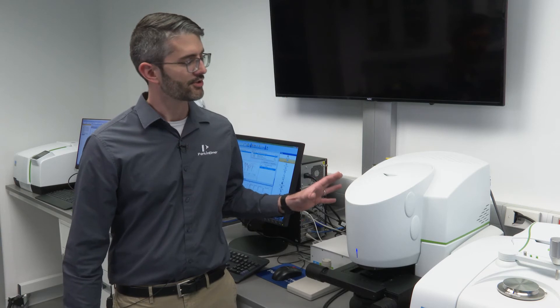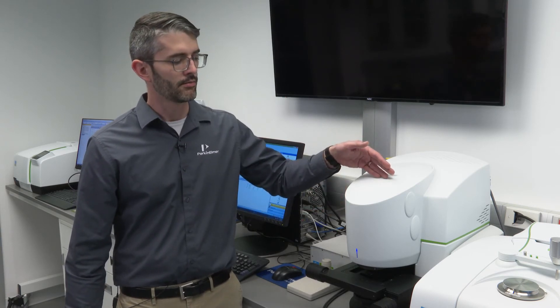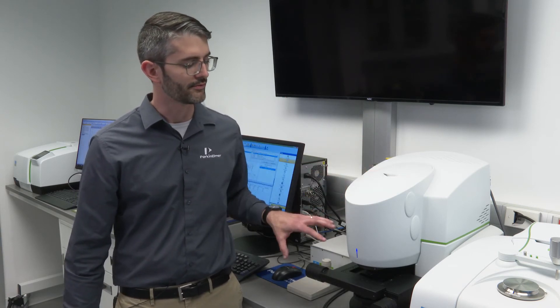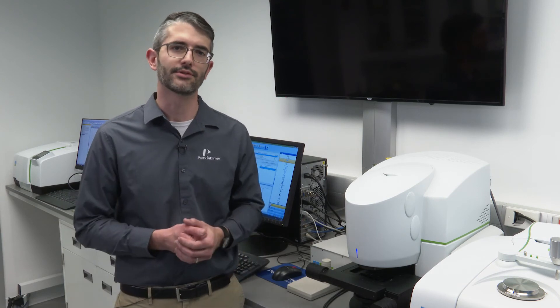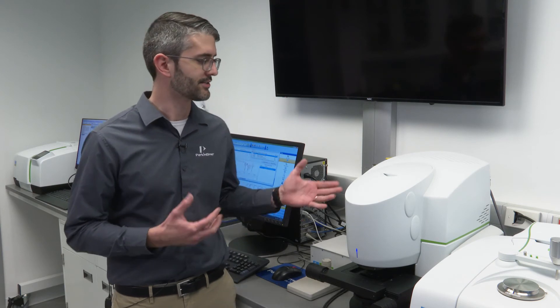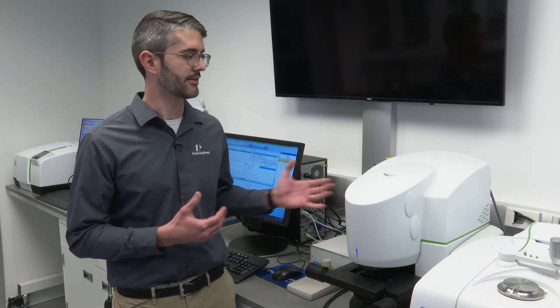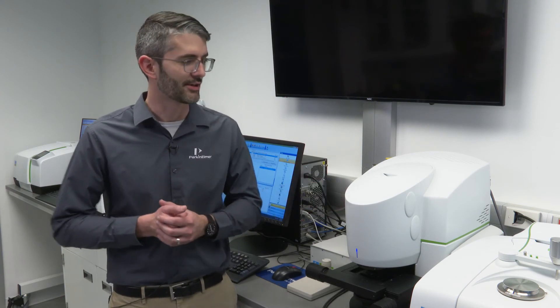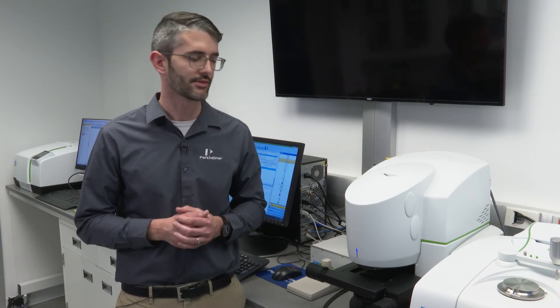These microscopes also employ a CCD camera, which is able to view the sample. This allows you to identify a region of interest on a sample using visible features, as well as, with the Spotlight 400, having the ability to measure a full infrared image to identify regions of interest.